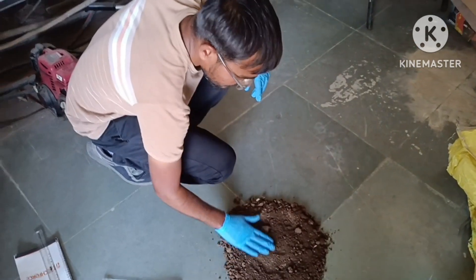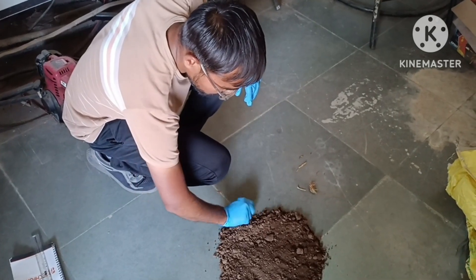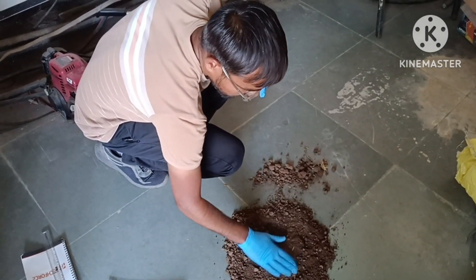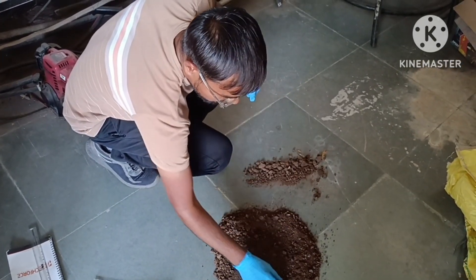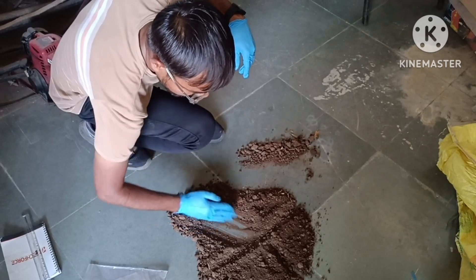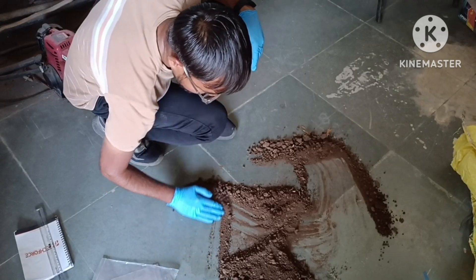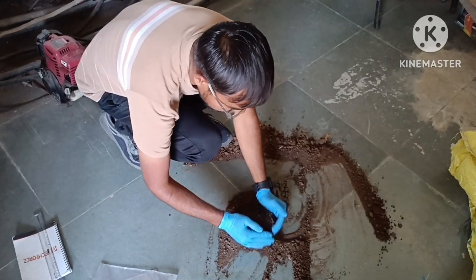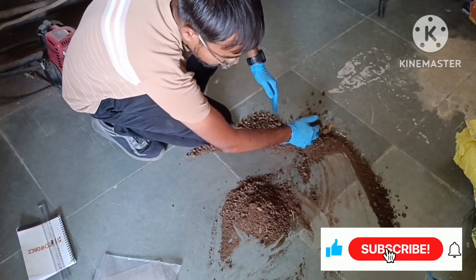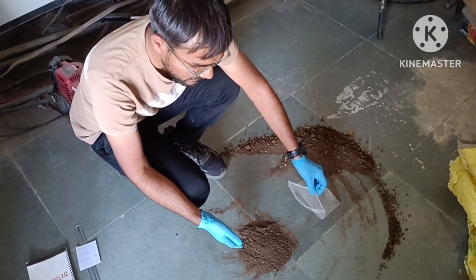We are making a circle like this, removing all the particles and stones. Then after we are making a cross like this and removing this part. Then we mix what remains. Following this procedure, at the end we are left with around 250 grams of remaining soil.